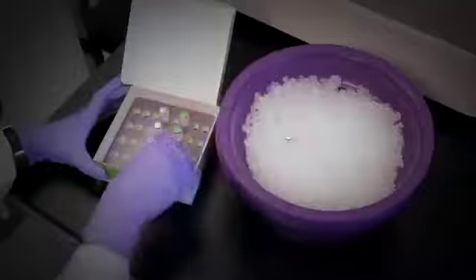Finally, you will need the n-counter hybridization buffer. This is supplied in a tube in the master kit stored at room temperature along with the tips and tubes.